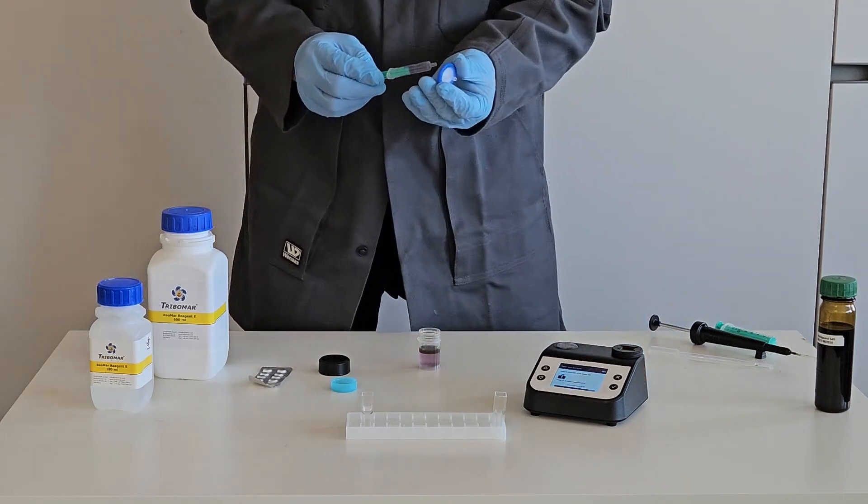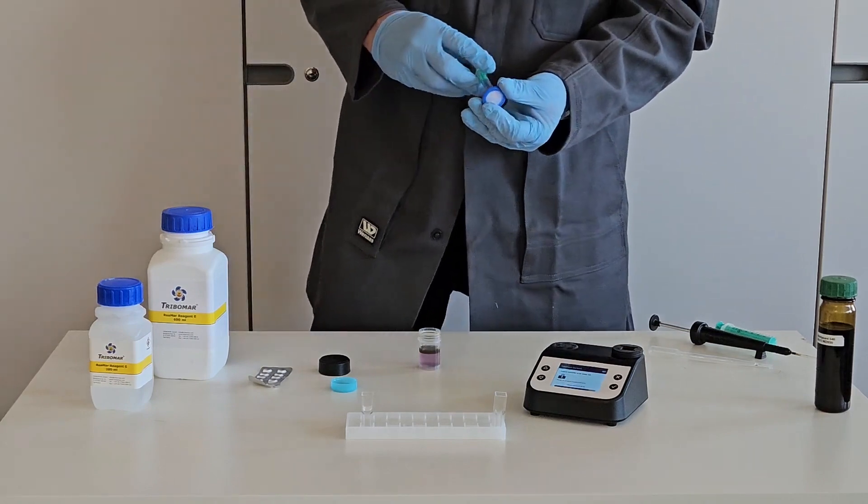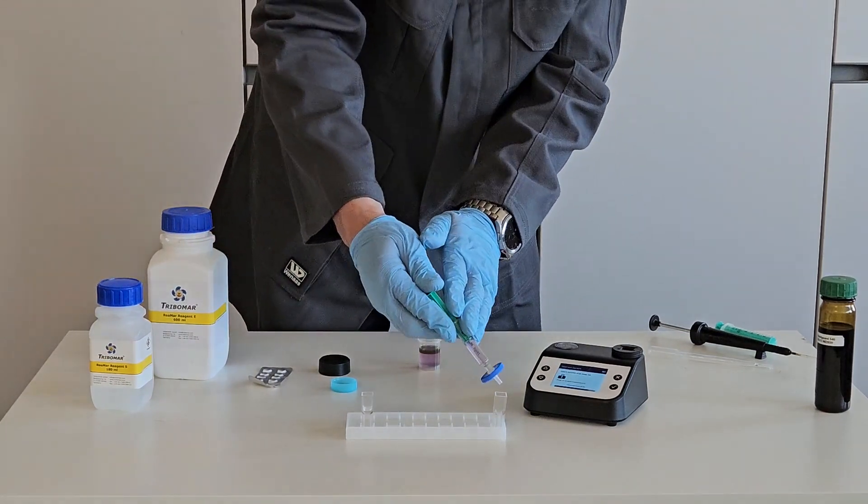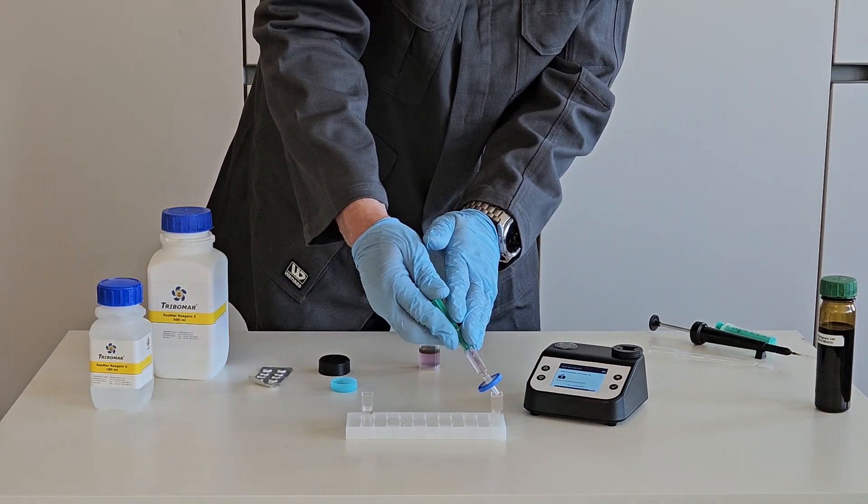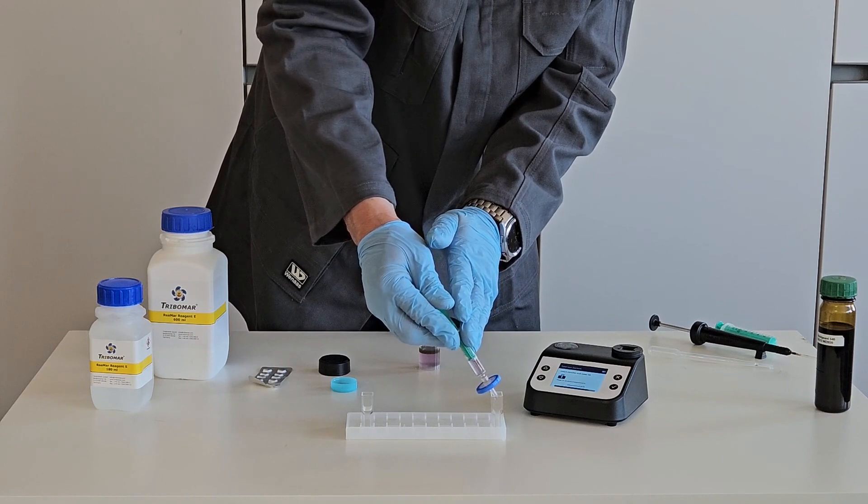Use now a filter and fill the liquid carefully into the empty cuvette.